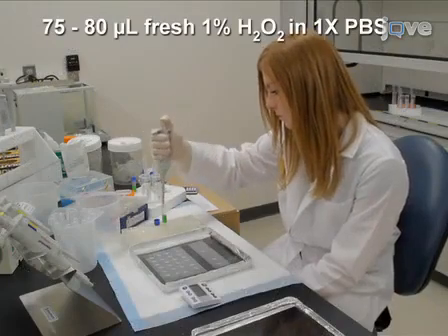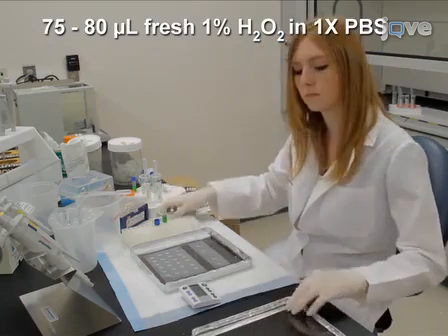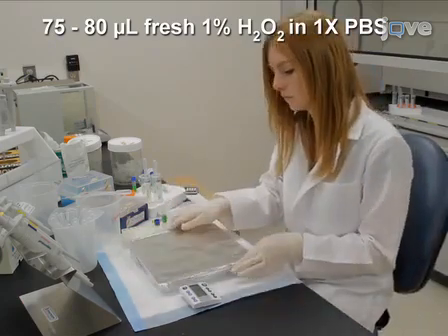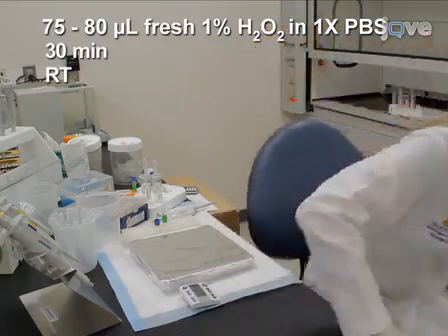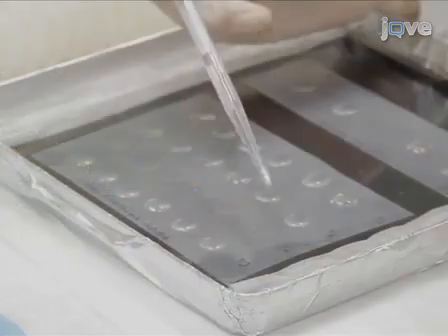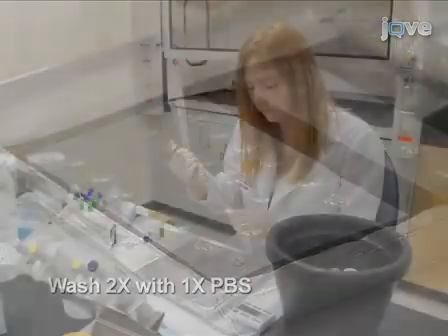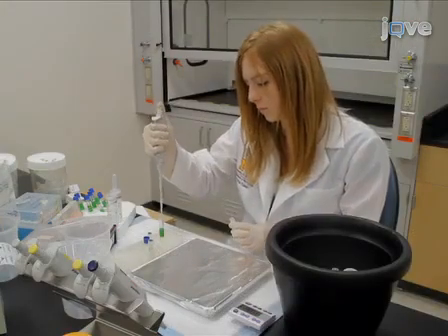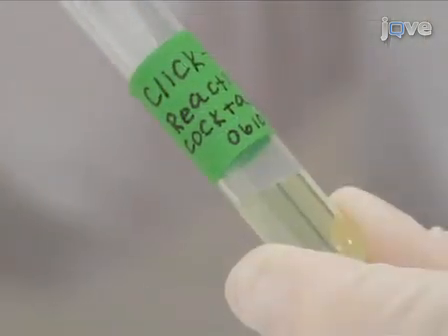Pipette 75 to 80 microliters of fresh 1% hydrogen peroxide in 1x PBS onto each cover slip. Incubate covered for 30 minutes at room temperature to quench endogenous peroxidase activity. Rinse twice with 1x PBS as before. Freshly prepare the Click-iT reaction cocktail as detailed in the accompanying text. Pipette up and down to mix, do not vortex.